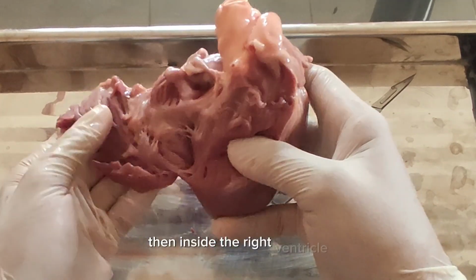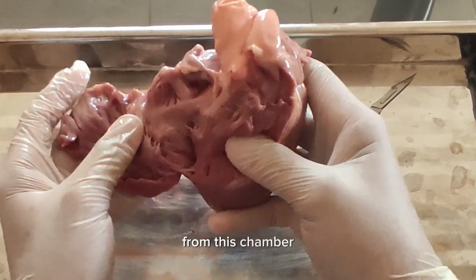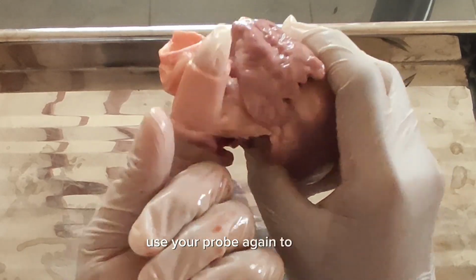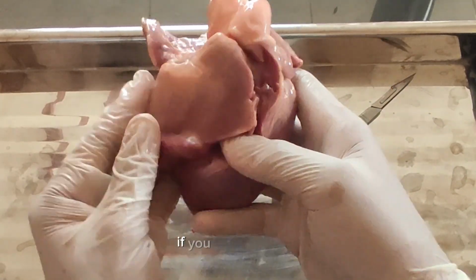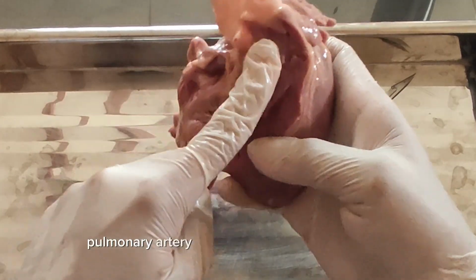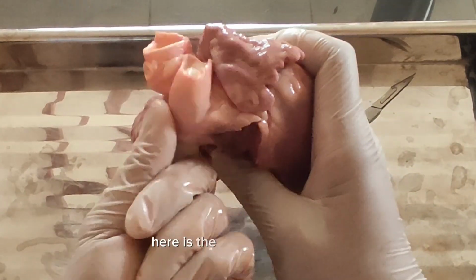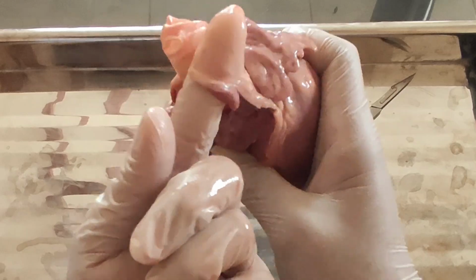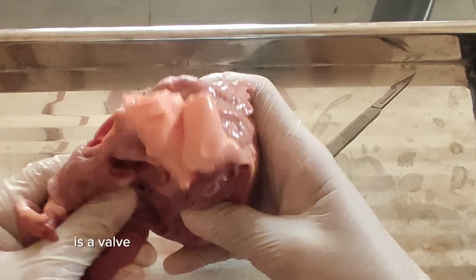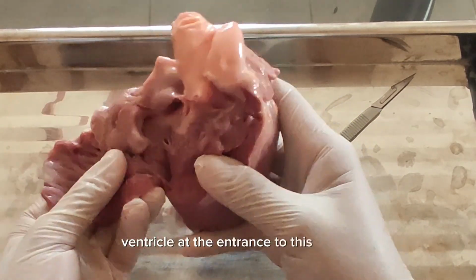Then inside the right ventricle, locate the pulmonary artery that carries blood away from this chamber. Our pulmonary artery is right here. Use your probe again to feel it. This is our pulmonary artery. It goes through the right ventricle. Now, this pulmonary artery has a valve that controls blood flow away from the right ventricle at the entrance to this vessel.